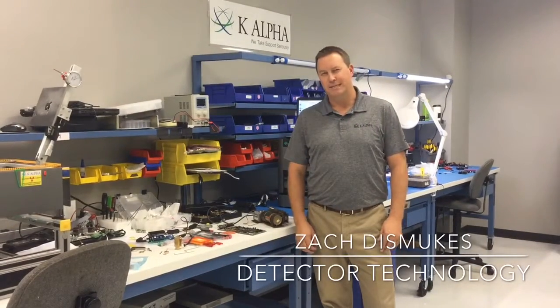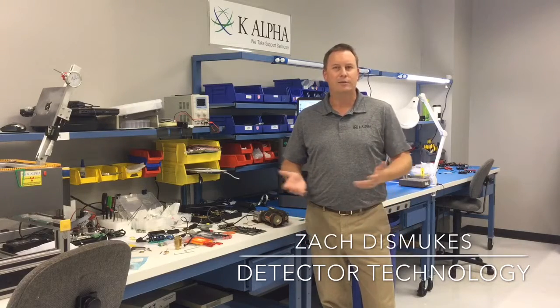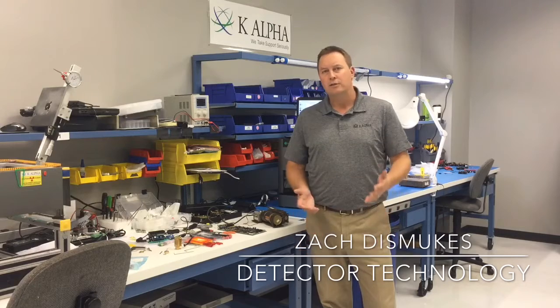K alpha. One of the questions I get a lot from customers is relating to detectors, the different types, what does it mean, and how does it relate to my application needs. So that's what I'm here to talk about today, the detector technology. A lot's changed over the years.